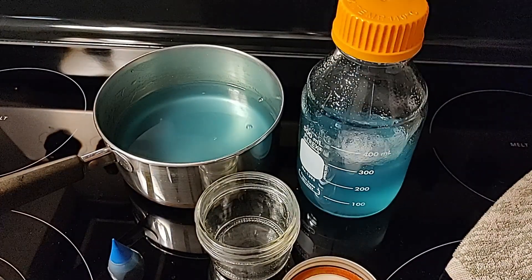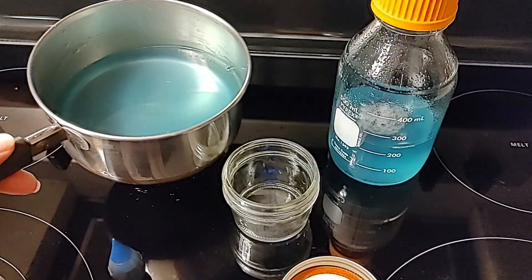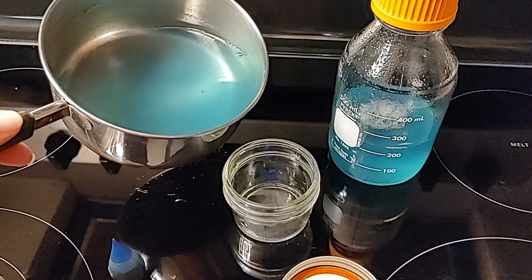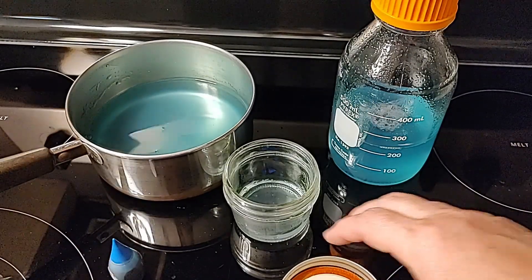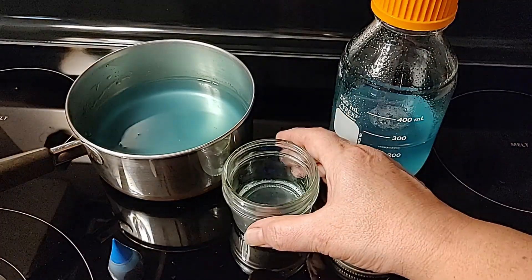We actually love using the blue food coloring because you can really see that white mycelium — it's just gorgeous. The blue really does create this clean agar effect. The other reason would be to color code your agar dishes and no pour jars by recipe.